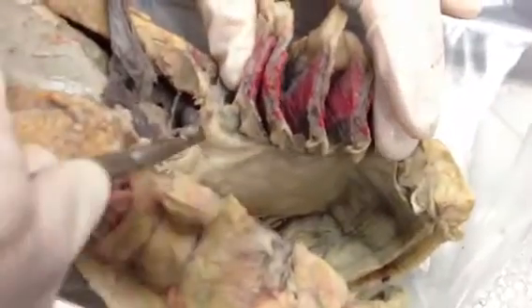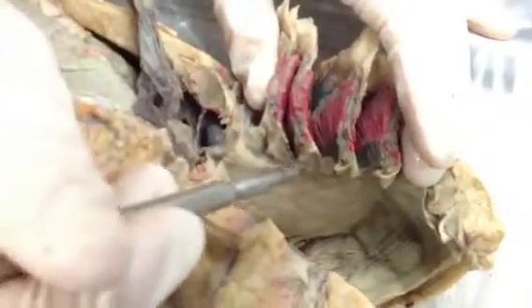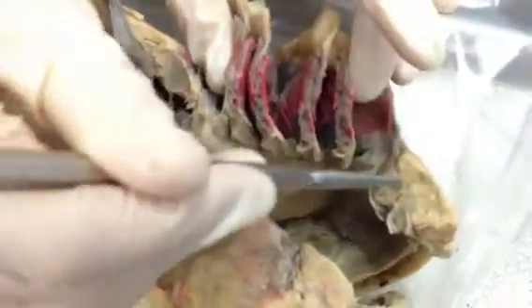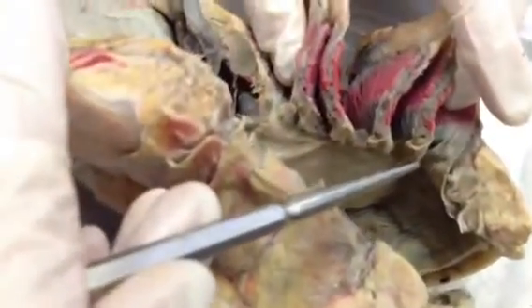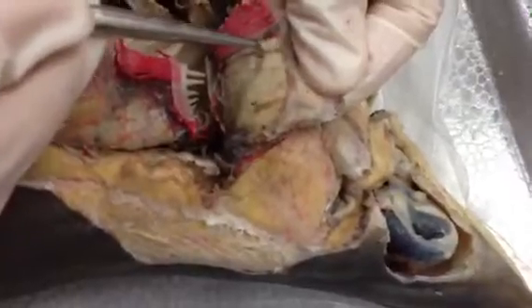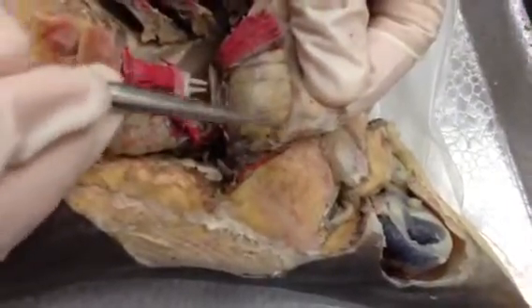Actually, correcting that: the order going back is fifth, fourth, third, second, first. And then this would be the hyoid arch here. The gill rays — when you scraped off some of the lamellae, you saw the interbranchial septum. The gill rays are just the cartilages in between, and those are there to prevent the gills from collapsing on themselves.